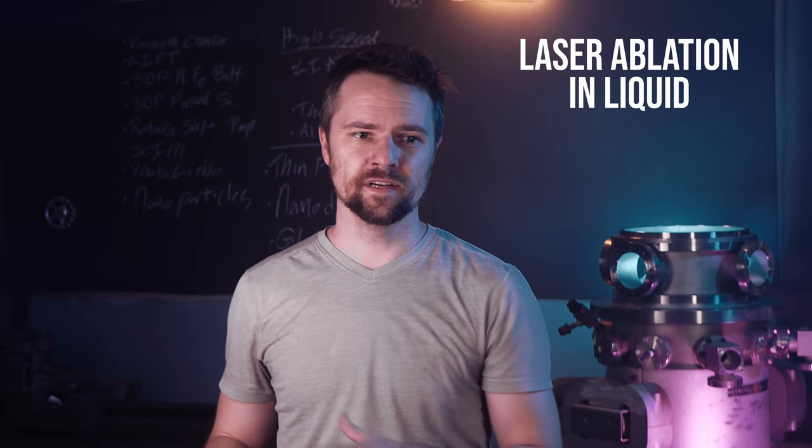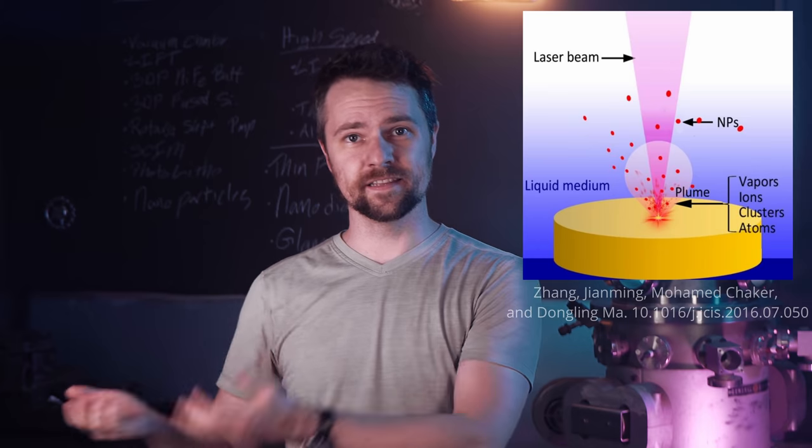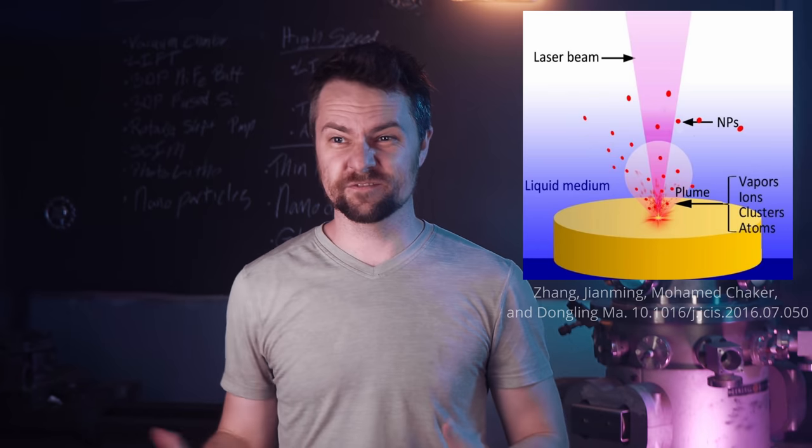First I want to talk about how to synthesize these nanoparticles, because it's actually pretty easy. The technique I use goes by a lot of different names, but it's most commonly referred to as laser ablation in liquid. It's basically what it sounds like — you have a laser, a liquid of your choice, and a substrate of choice, and you ablate the substrate in the liquid and you get nanoparticles. There is some nuance into what parameters you choose and what solutions you use.